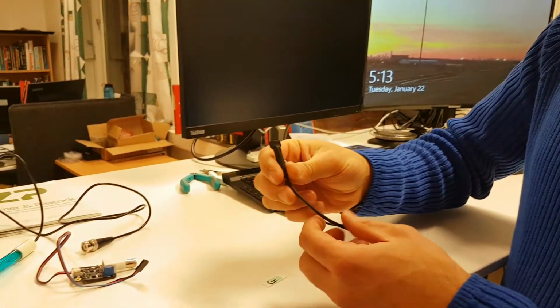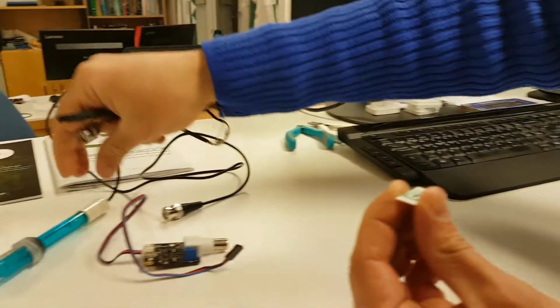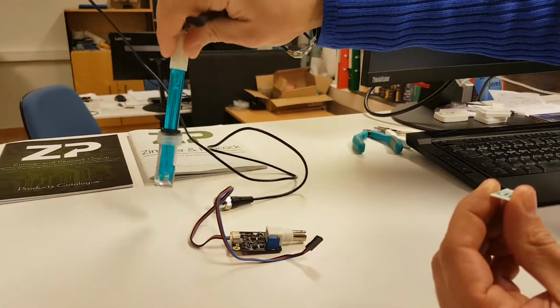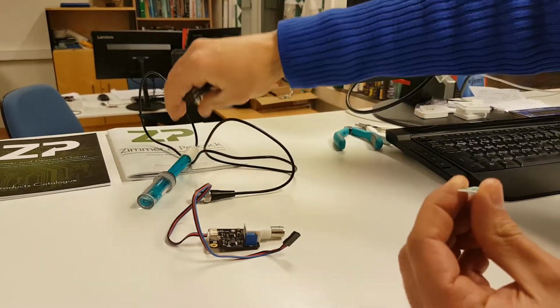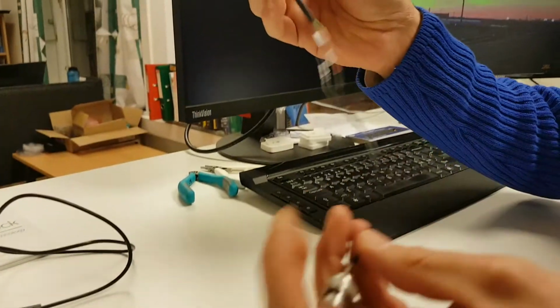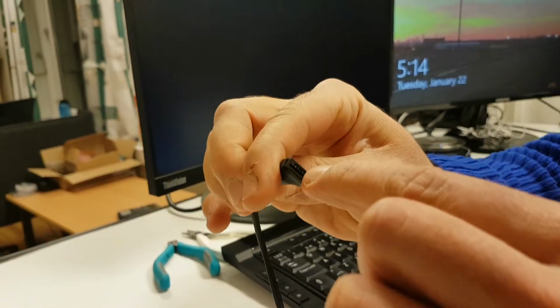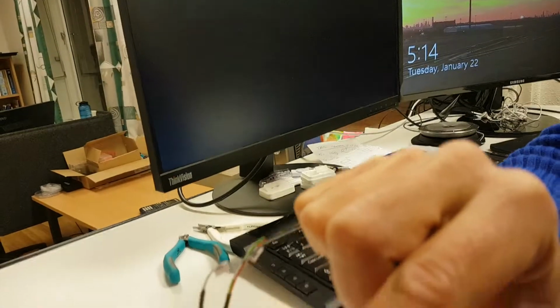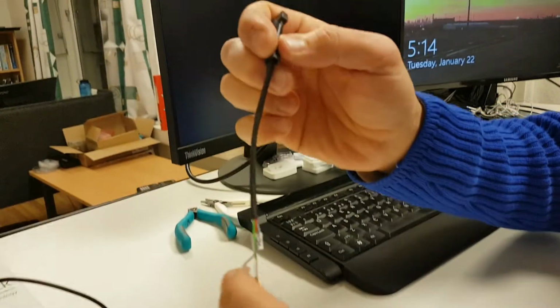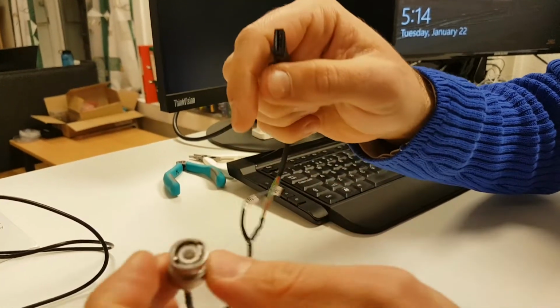I'm a research scientist here at Zimmer & Peacock, and I'm just going to exemplify how you need to connect our ZP sensor substrates instead of the gravity pH probe. So basically what we are doing is we have to build a connector to BNC cable where we connect the center pin, which corresponds to the working electrode, to the center pin on the BNC plug, and both reference and counter electrode to the shield that goes on the BNC.